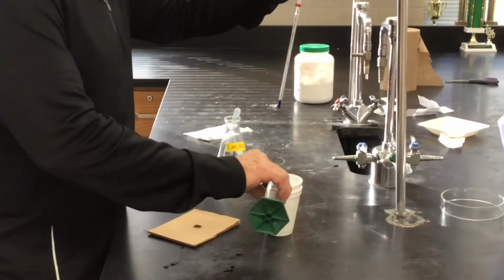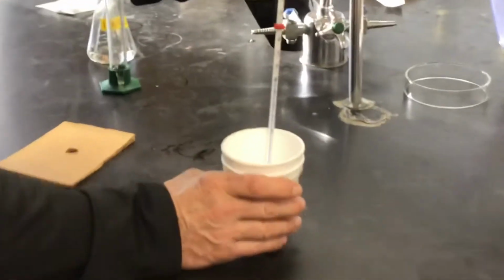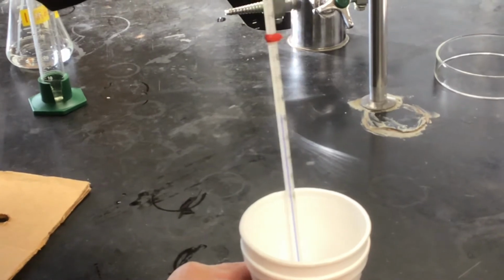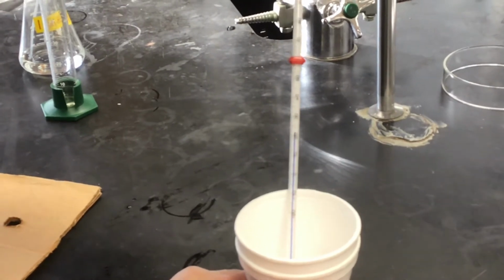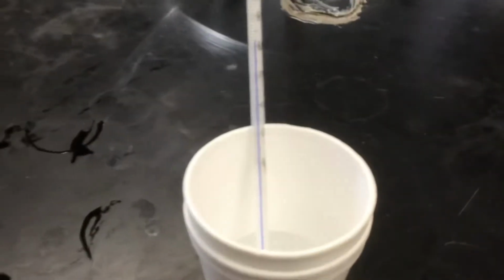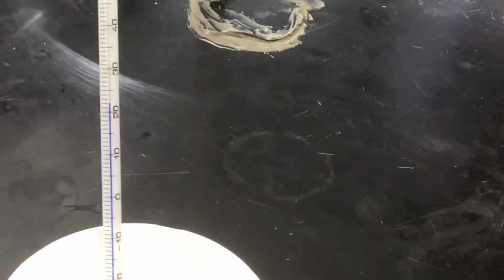Okay, so I'll dump the acid into our calorimeter. We'll need that initial temperature. So let's see if we can get the thermometer to stand up. Doesn't always want to. Well, it's not going to stand up. We have seen so many setups like this that have been bumped and fallen over. In fact, we did one of ourselves in an earlier trial. Come on. Okay, there.